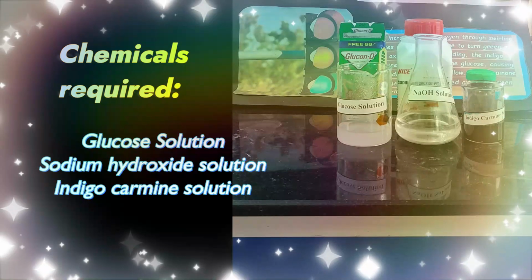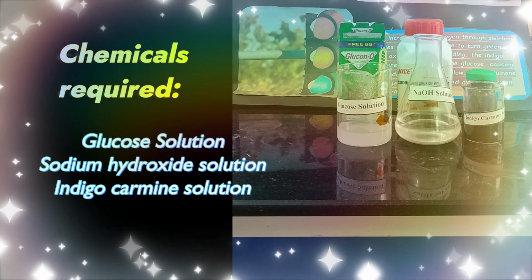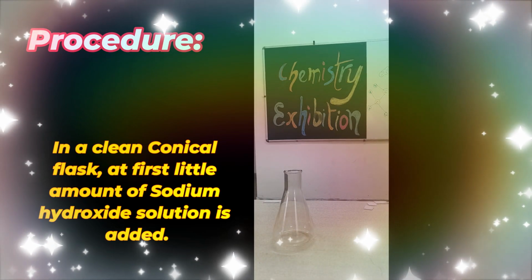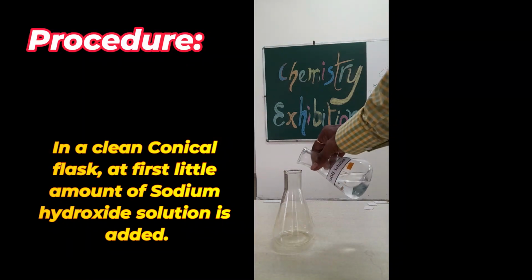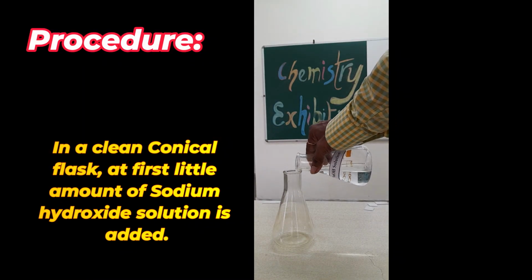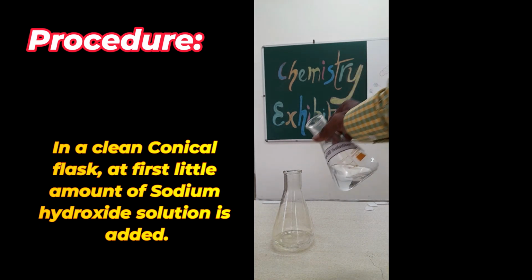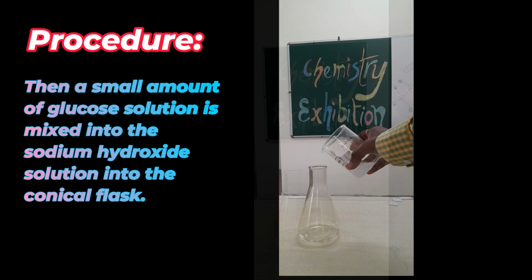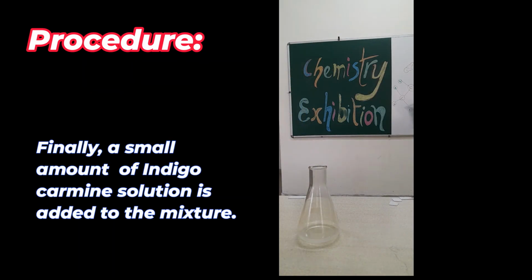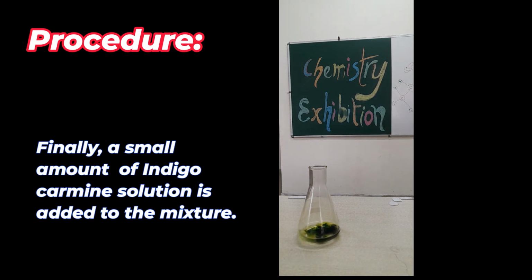Chemicals required: glucose solution, sodium hydroxide solution, and indigo carmine solution. Procedure: in a clean conical flask, first a little amount of sodium hydroxide solution is added. Then a small amount of glucose solution is mixed into the sodium hydroxide solution in the flask. Finally, a small amount of indigo carmine solution is added to the mixture.